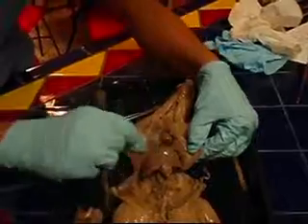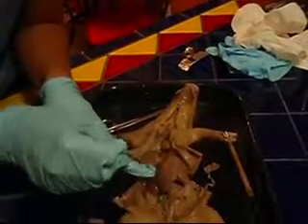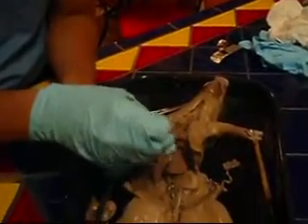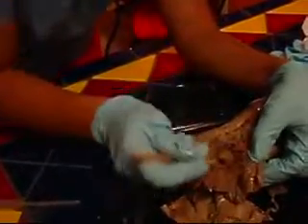Identify the diaphragm. Remember that the diaphragm separates the abdominal cavity from the thoracic cavity, and it aids in breathing. Next, remove the pericardium, which is a membrane that surrounds the heart. This membrane is also located over many of the organs and can get in the way when you're looking at them.